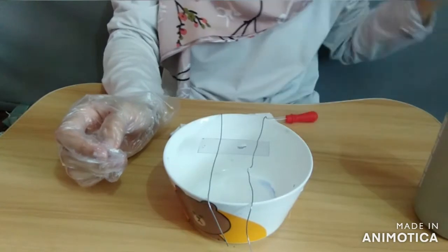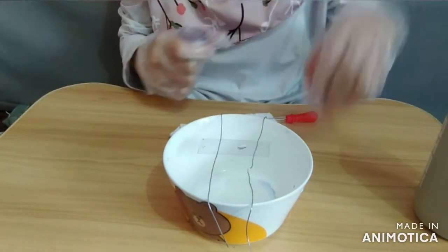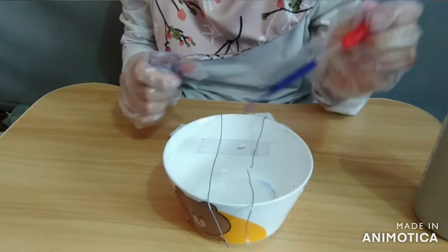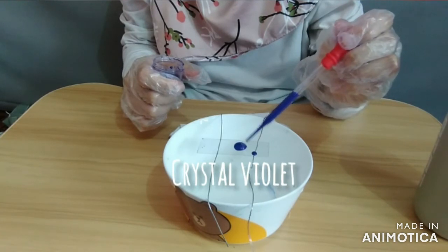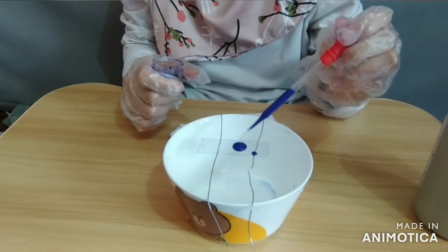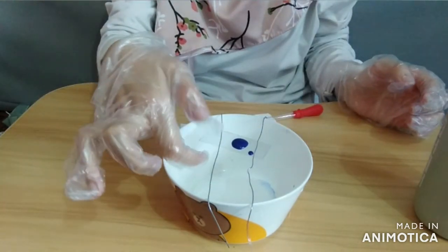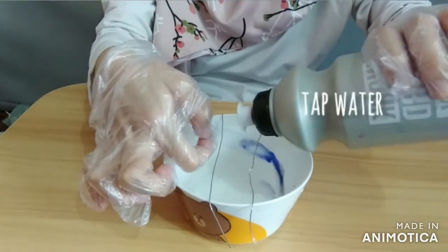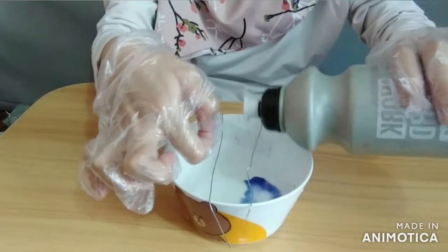First of all, add the primary stain, crystal violet, for a minute. Then gently wash off the stain with tap water.